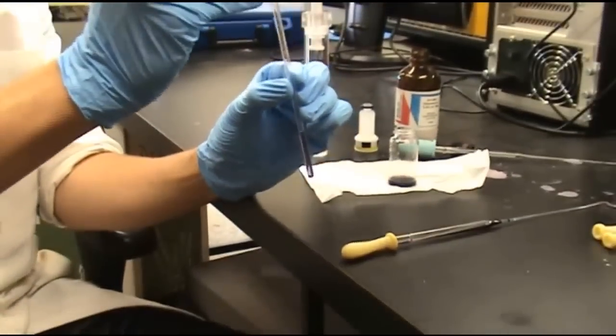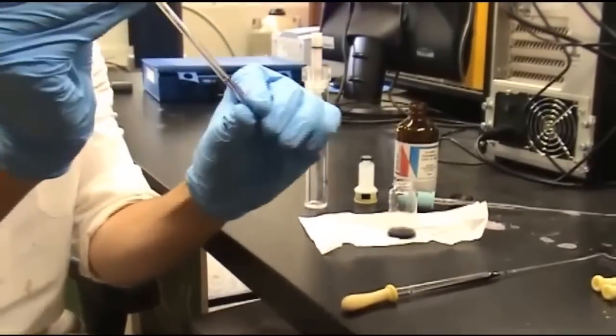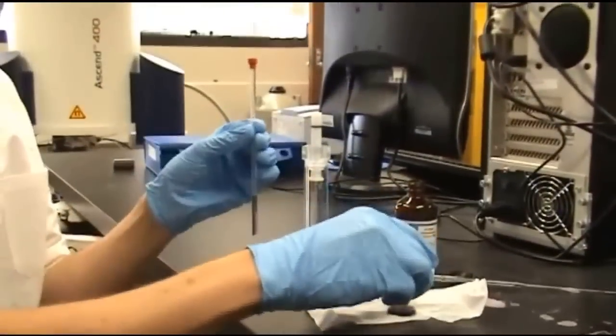Next we'll need to cap our tube. Be sure that the cap is on firmly.